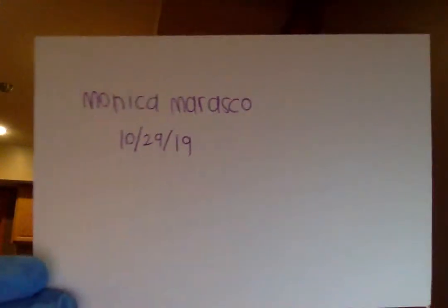My name is Monica Marasco, and today I will be doing the sheep heart dissection video. On the other side of this paper, I have the list of things that we are to identify.